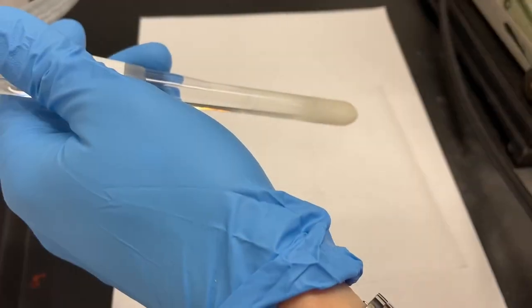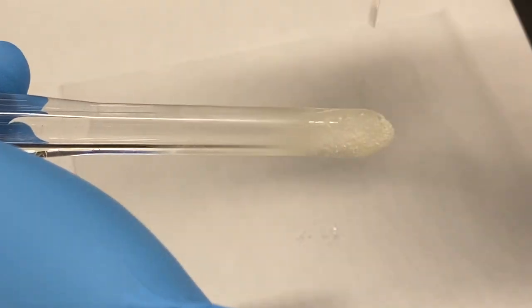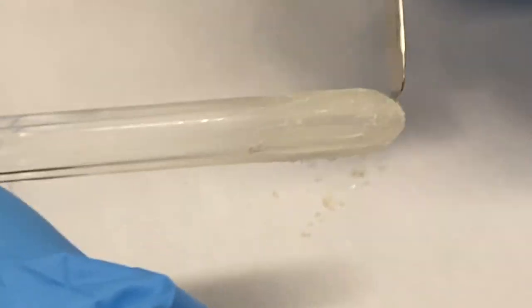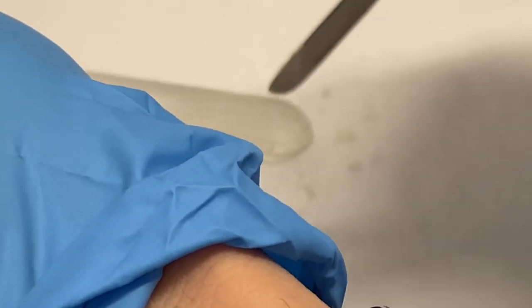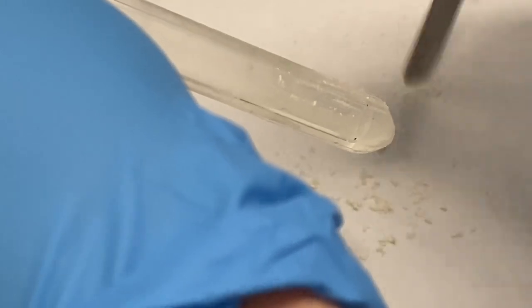This is more of the normal situation where you have material on your cooling finger. One thing that you can do is just scrape it off with a spatula. Often doesn't look like much, but when you're done you have some significant amount. Normally there's a huge crust at the bottom. What you can also do is just hold it over a beaker or a round bottom flask and rinse it down with your solvent of choice, and then roto-vap everything together.